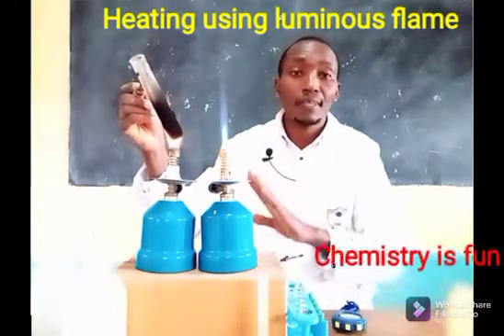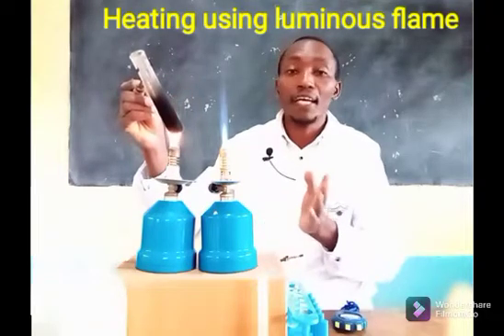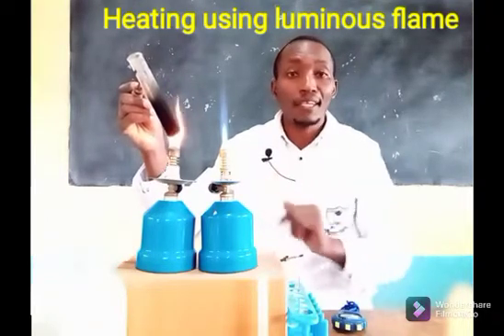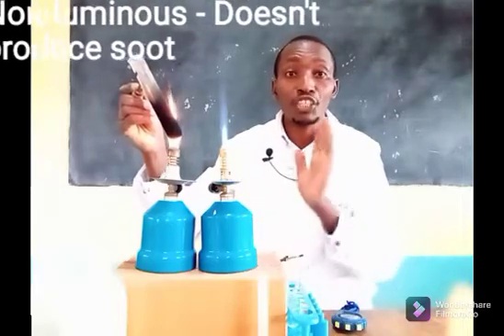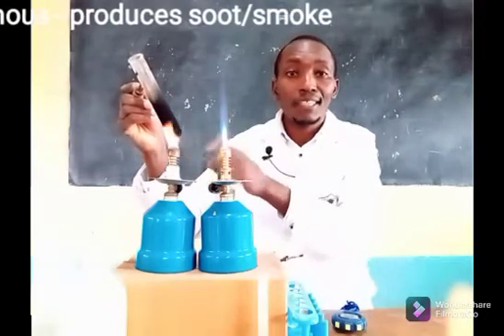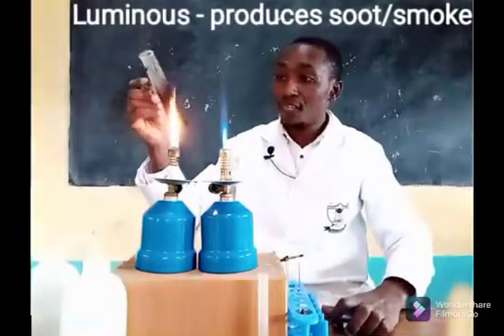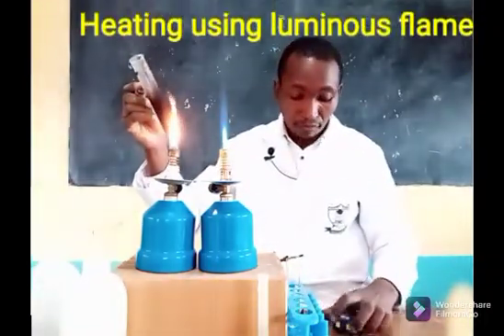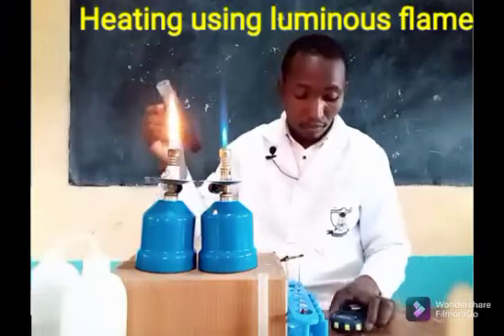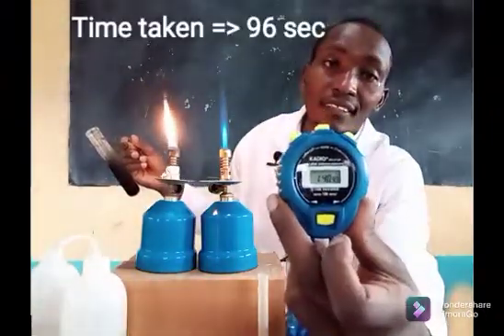While we are waiting for the water to boil, we can also talk about another difference: the non-luminous flame did not produce soot, while the luminous flame is producing the black substance called soot. My water has now boiled at 1 minute 36 seconds, which tells you another difference — the non-luminous flame is much hotter.